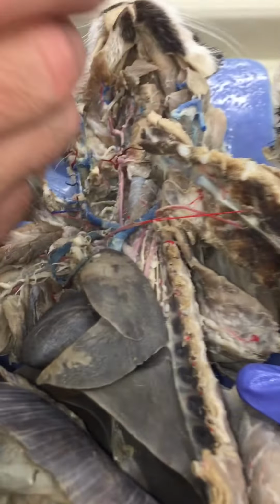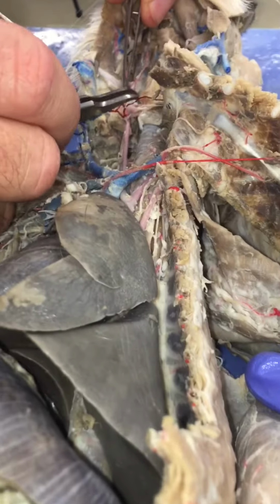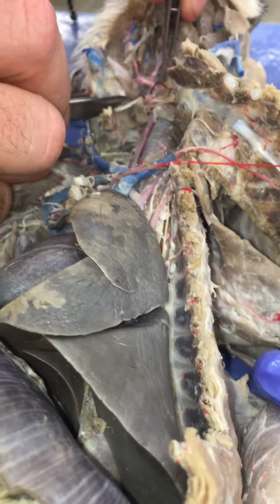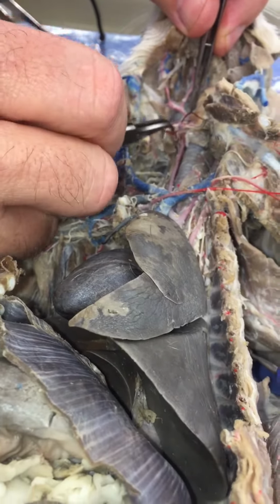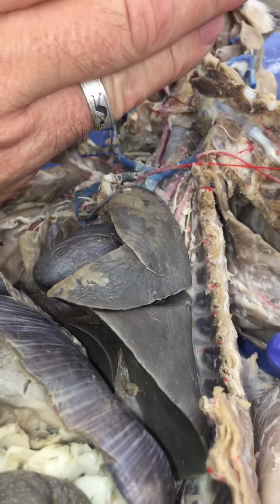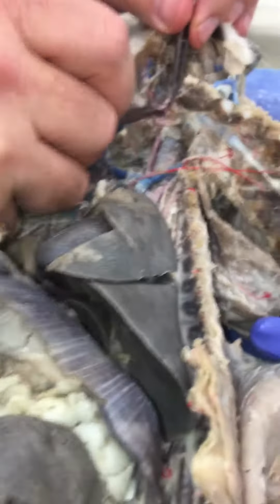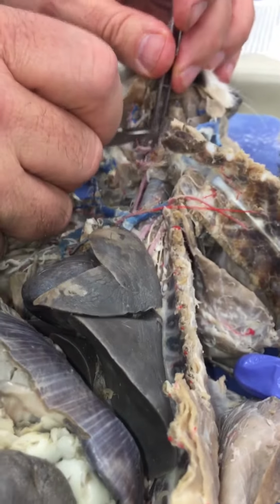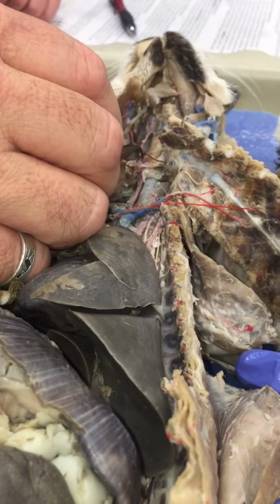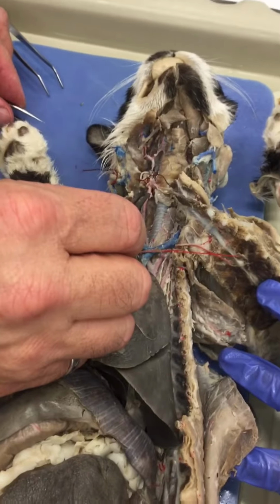in the cats. Now the internal carotid, sometimes you can find it, sometimes you can't. So I usually don't require that people identify that because it looks like part of the fascia that's connecting all these. And so it's really tough to identify specifically the internal carotid. But it's important to note that it comes off in this region because caudal to that, it's common carotid.